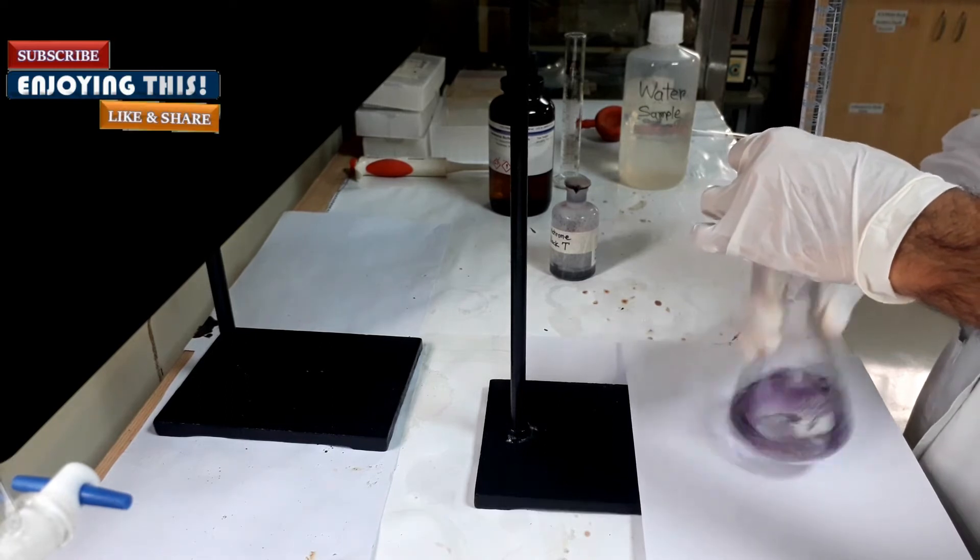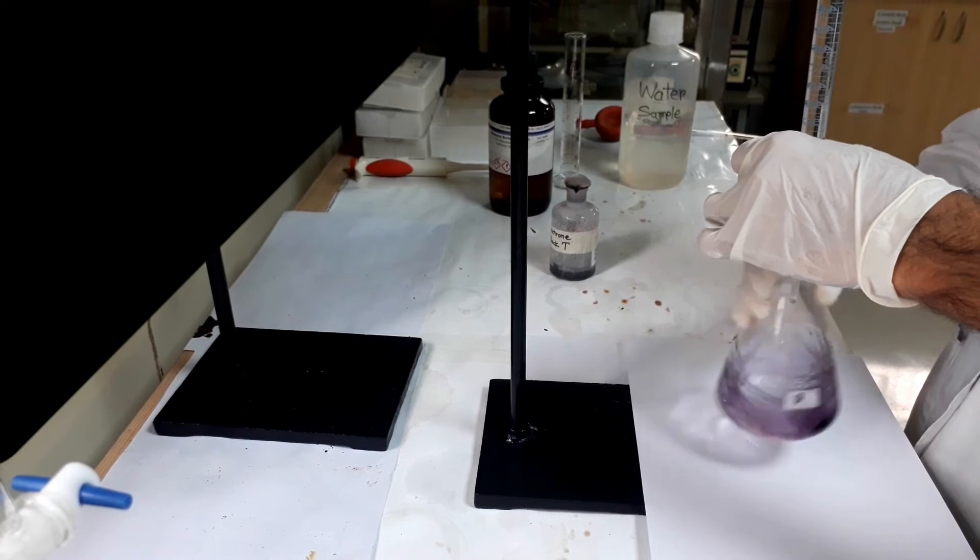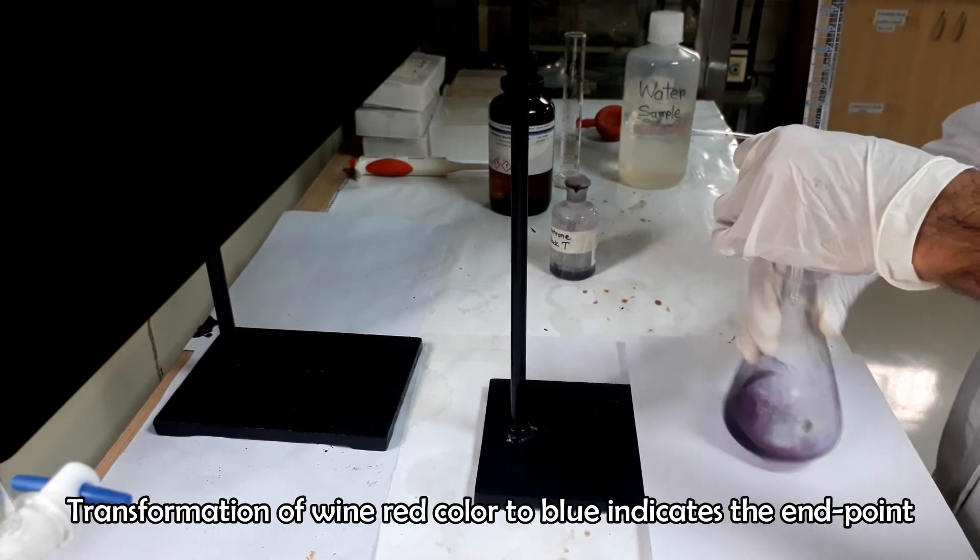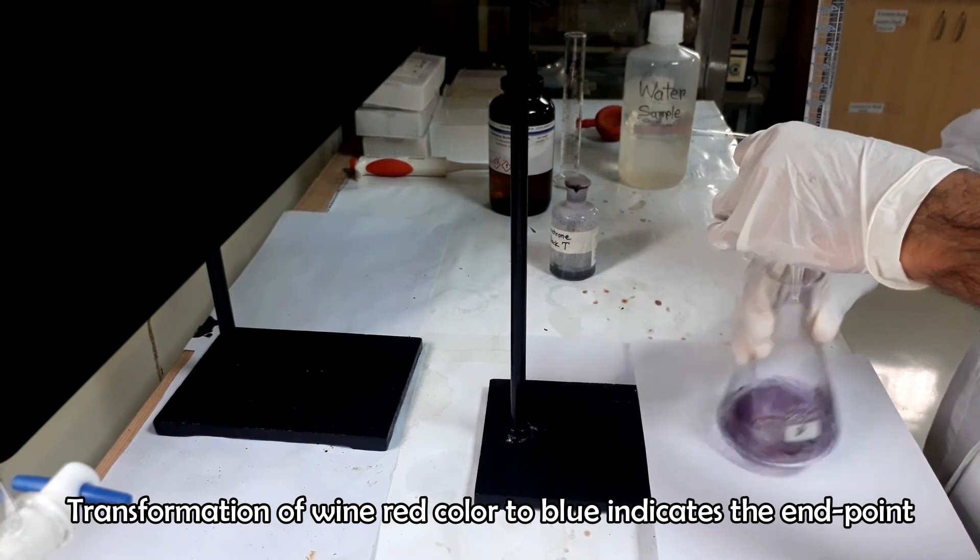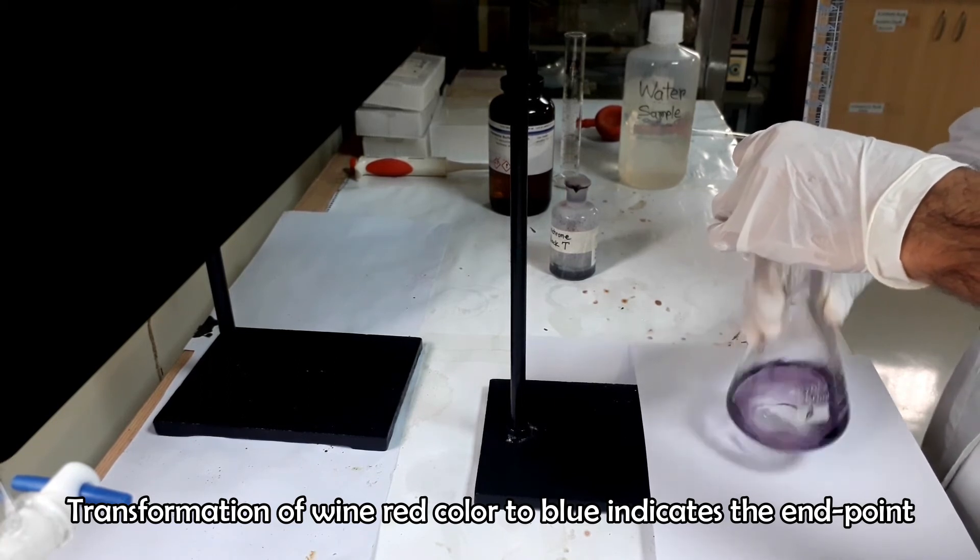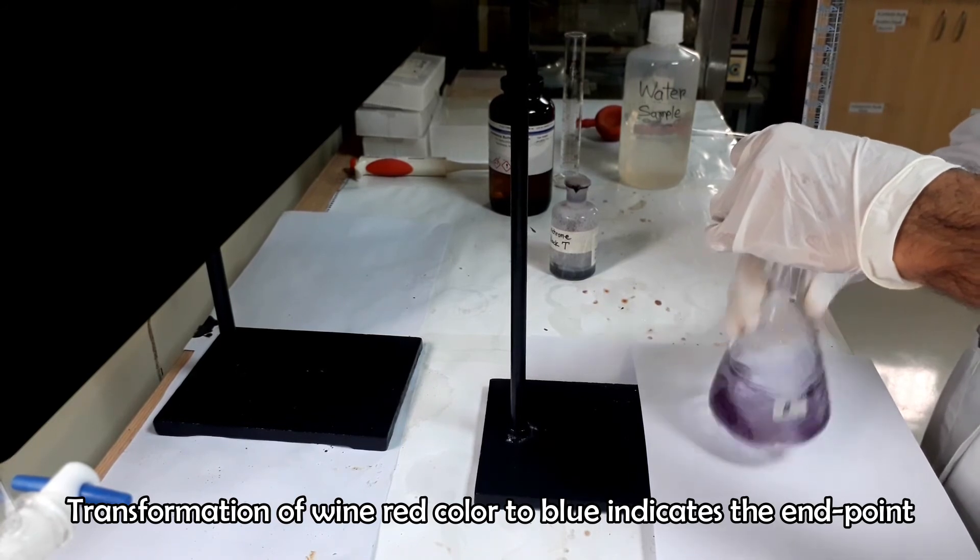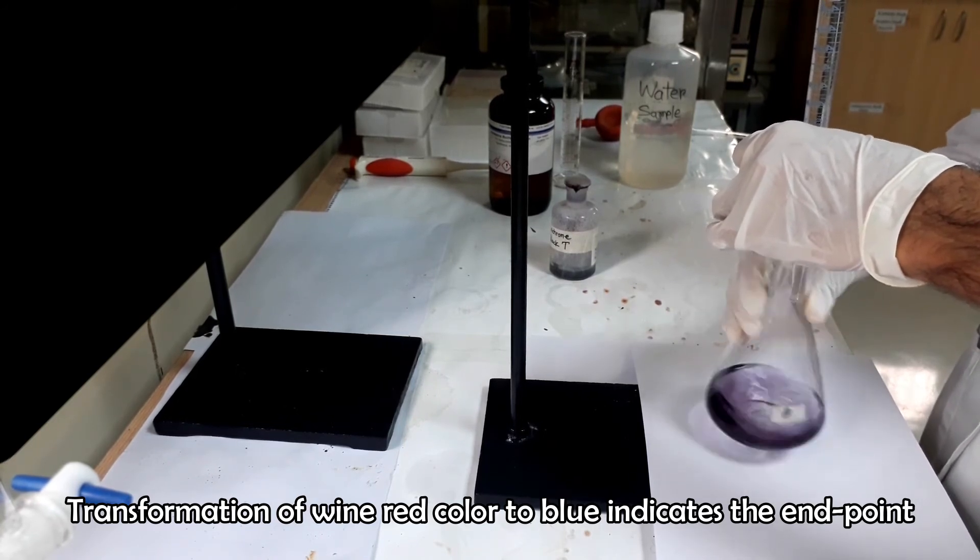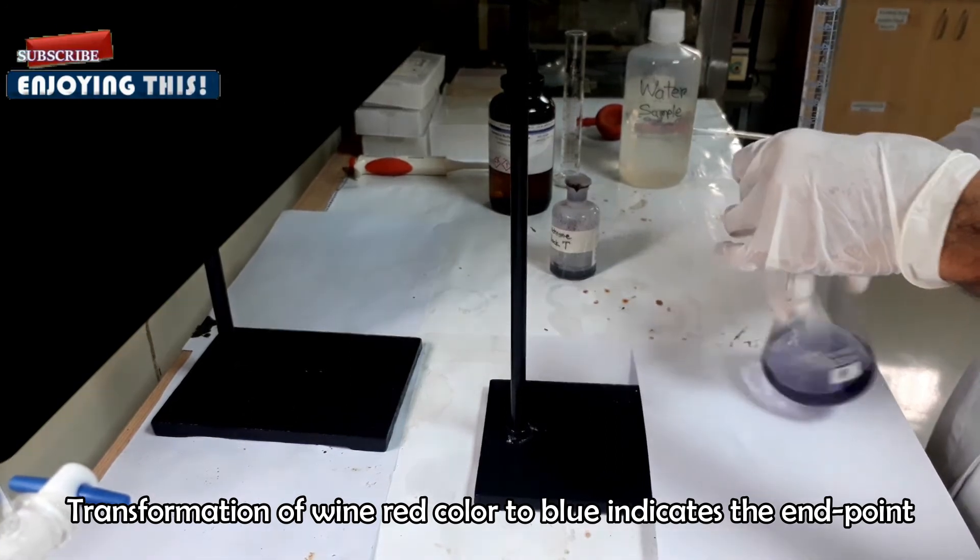Shake the flask vigorously during titration. Wine red color to blue indicates the endpoint of the titration.